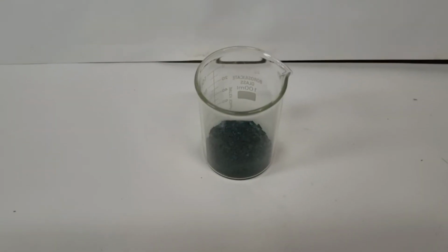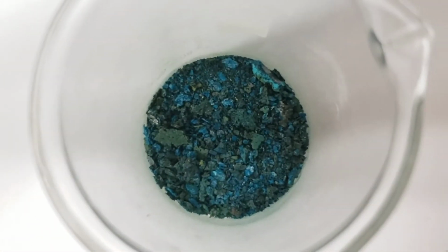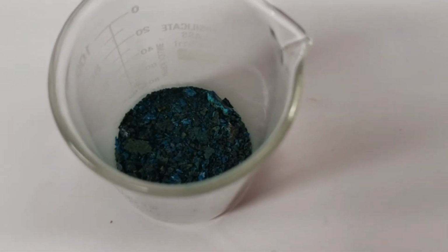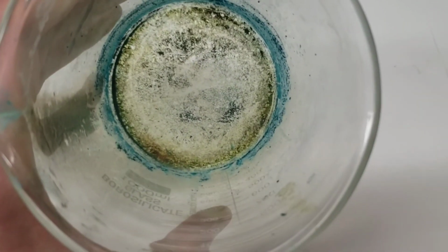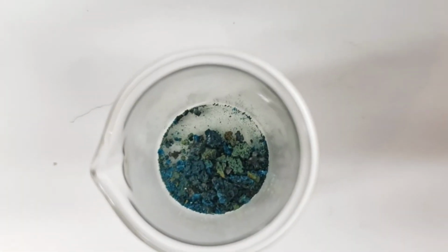And so here's the other copper acetate mess that I had after scraping it out of the beaker. And you can see, again, the mix of the colors. In this case, the bluish of the copper acetate, and the darker clumps of the carbon. And in addition, what I had left in the other beaker had a lot of copper acetate around the rim, but just a ton of carbon residue on the bottom, which is of course where it was right up against the heat of the hot plate. But I wanted to see if I could somehow separate the carbon from the copper acetate.